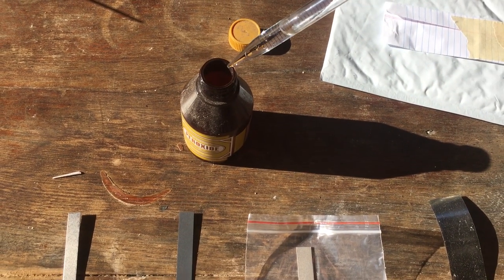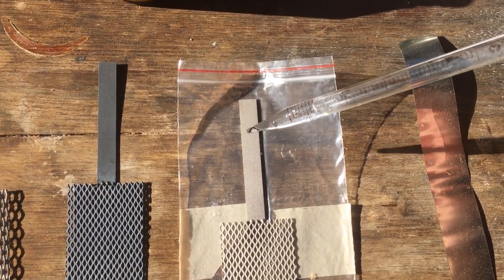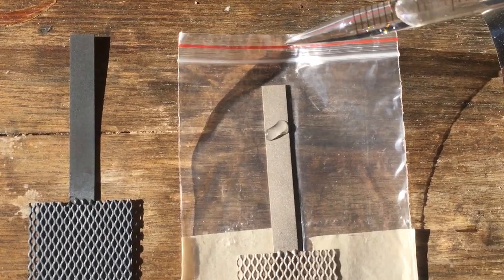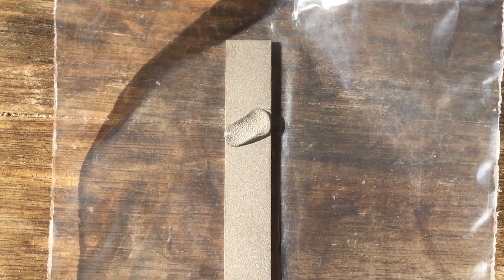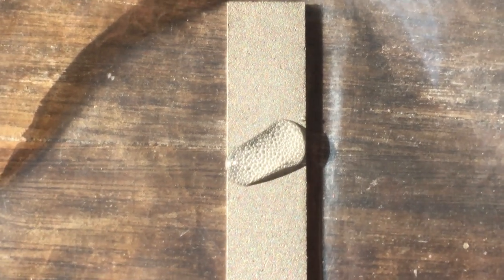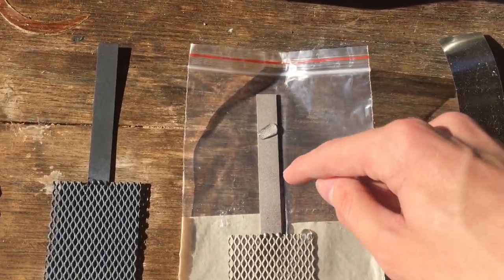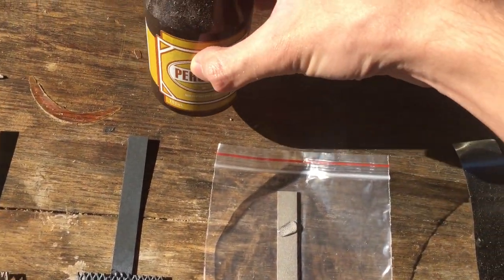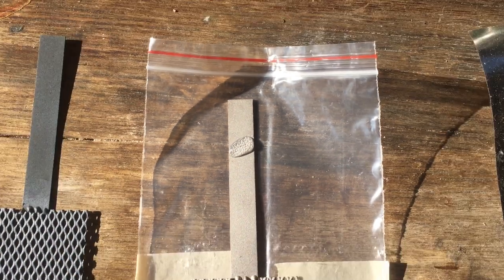So literally all we have to do is get a little bit of hydrogen peroxide in a pipette. I'm pretty sure the strip here is also coated in platinum, so if we put a bit of hydrogen peroxide on there we should see some reaction. And after a few seconds you can see clearly there is a whole bunch of oxygen gas being liberated off the anode surface, so it's very clear that the metal coated on this electrode is catalytically decomposing the hydrogen peroxide. That's a definite reaction there.